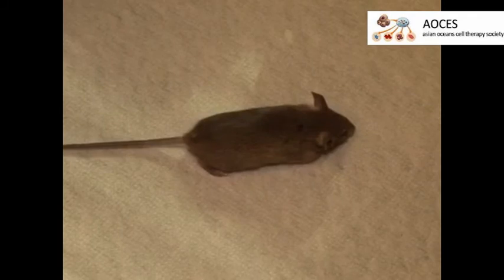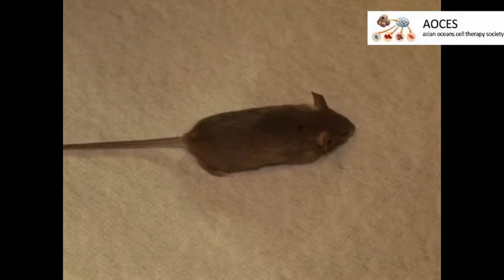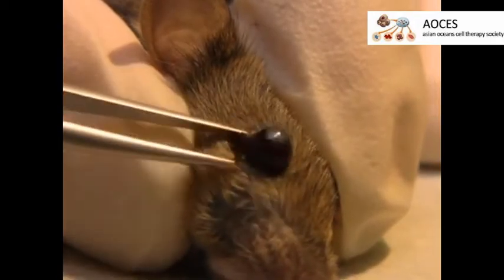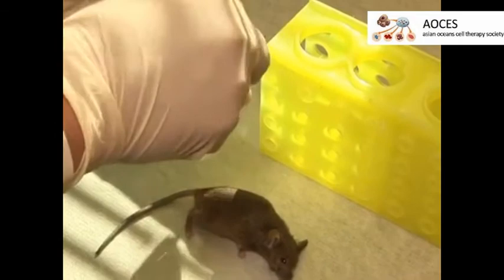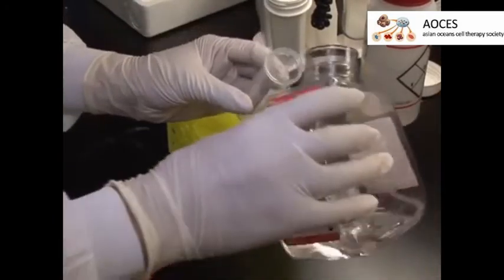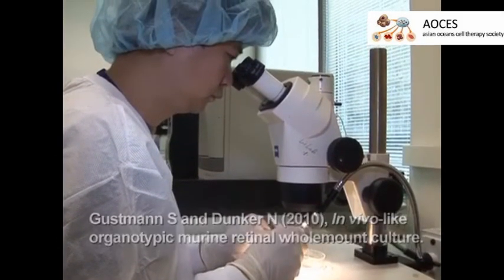The retinae are harvested 7 days after the optic nerve crush procedure. After euthanizing the mouse by carbon dioxide asphyxiation and cervical dislocation, use a pair of forceps to enucleate the eyes by applying pressure to the orbit. Immerse the eyes in 4% paraformaldehyde for 2 hours to fix. Then, remove the 4% paraformaldehyde and wash the eyes 3 times in PBS. After fixation, dissect the retina according to the previously published protocol. Image the surviving viable retinal ganglion cells in defined areas of the retina using a fluorescent microscope, and calculate retinal ganglion cell density from these images.